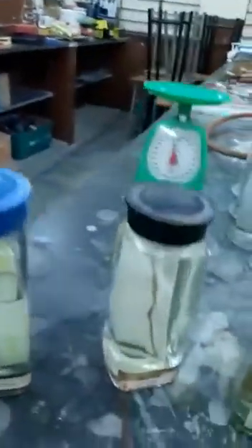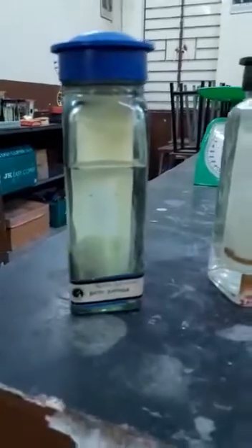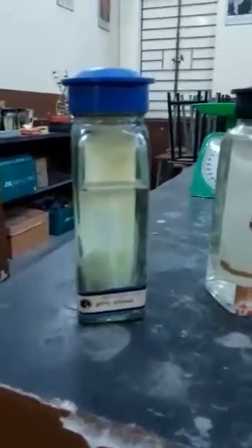But today we are going to see some specimens because we have recently done animal classification. The last lesson that we have done is animal classification, and so I have arranged some slides for specimens for you to see. And the very first one is a bath sponge.